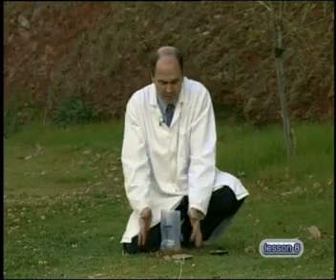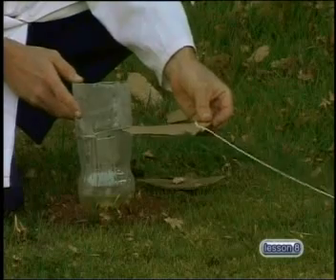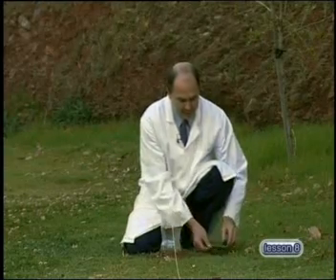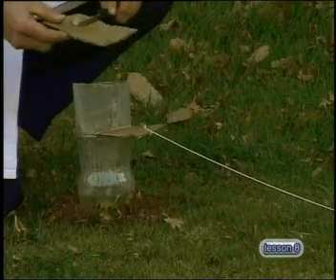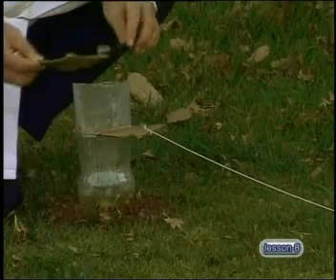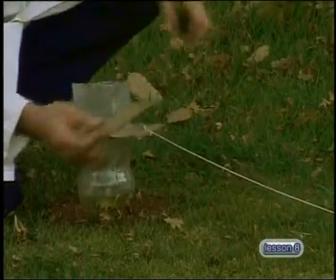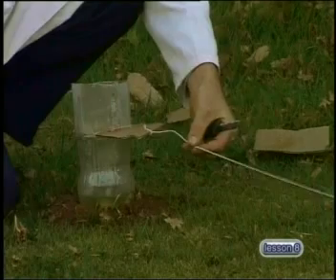I've secured it with some soil at the bottom over there. Now I'm going to place the card inside to make a trapdoor. Next, I'm transferring very carefully my group 1 metal, sodium, onto my trapdoor. Just about ready to set this explosion going.